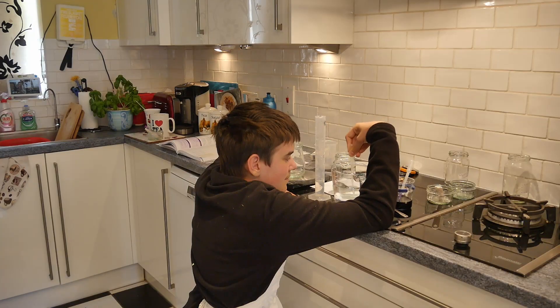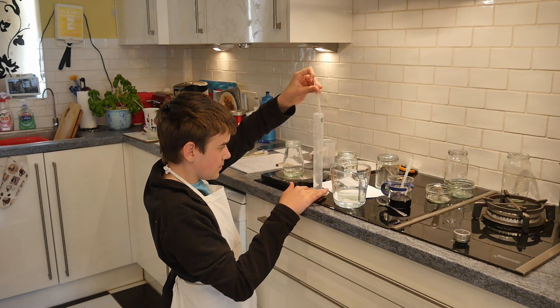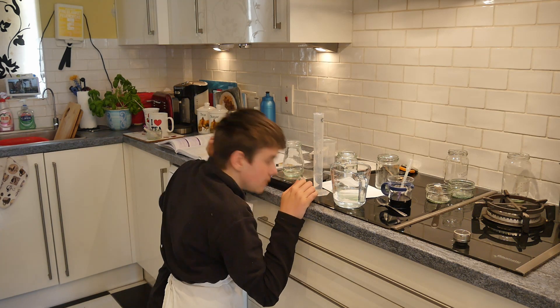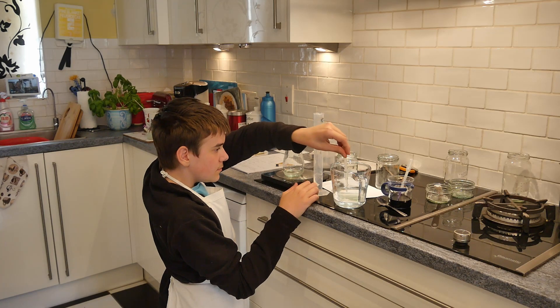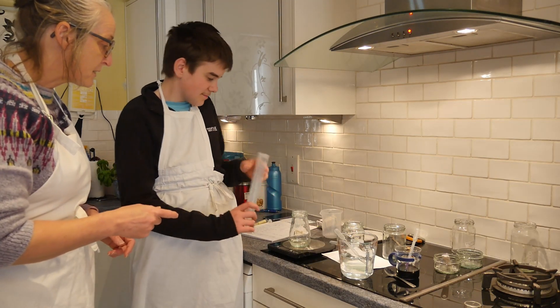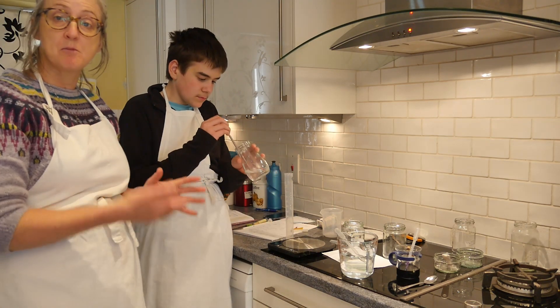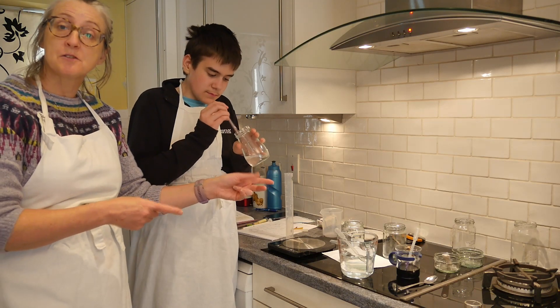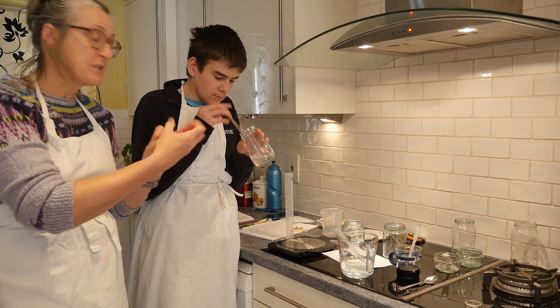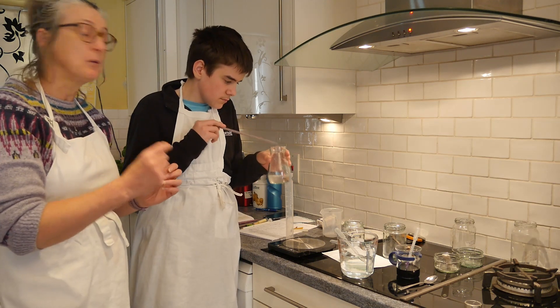We're going to pipette in the last 5 millilitres into the measuring cylinder. Looking from the side with your eye at the level of the meniscus, you get a much better view of where the meniscus is and can tell more accurately when you're at the 25 millilitre mark. We're stirring with a different chopstick, because we can't use the same one for both solutions — using the same apparatus for different strength solutions would change your solution strength just a little bit.